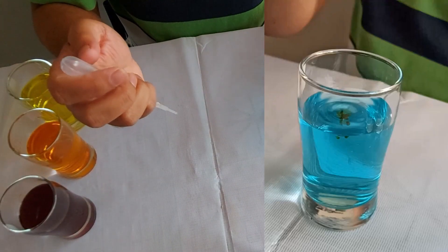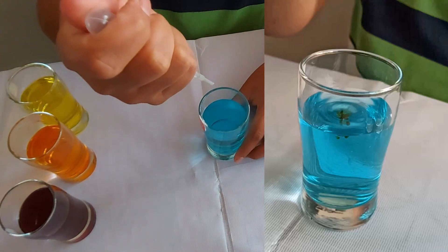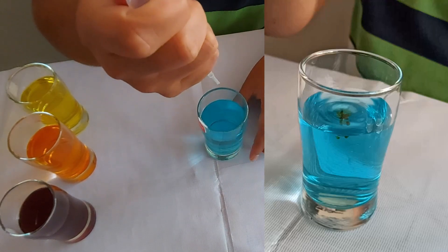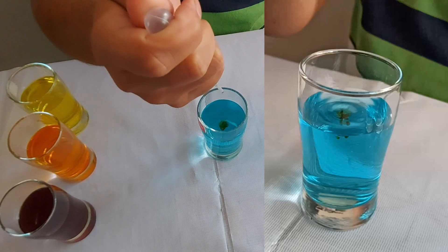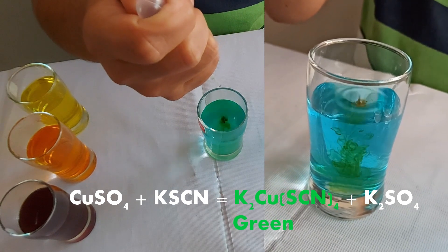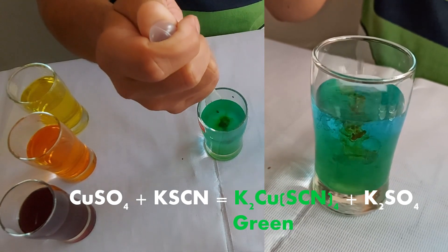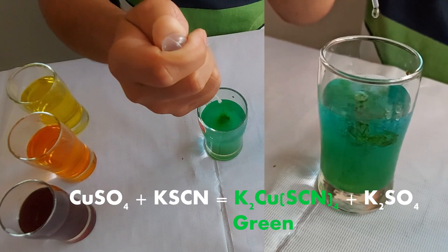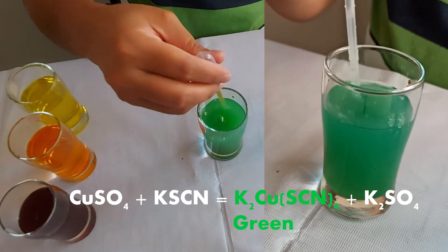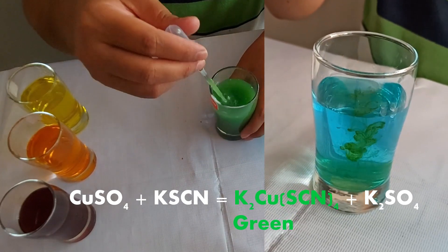Now we will do the green color from this blue copper sulfate solution. Let's see how it is turning to green. We are adding potassium thiocyanate solution to the copper sulfate solution. You see it is turning very nicely to green color from blue color. See, this is completely green color — that we turned from the blue color of copper sulfate solution.